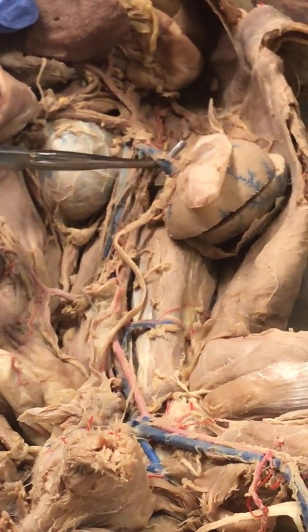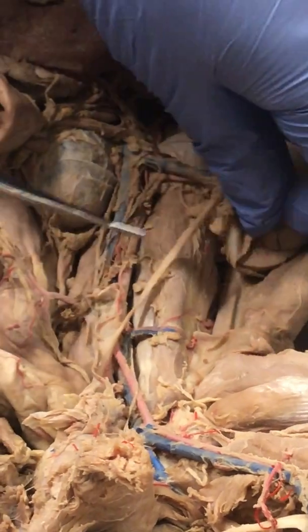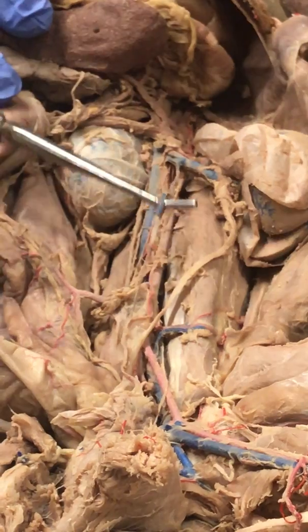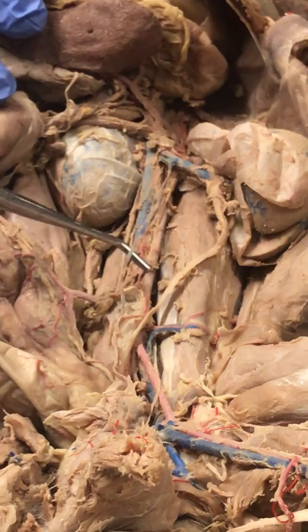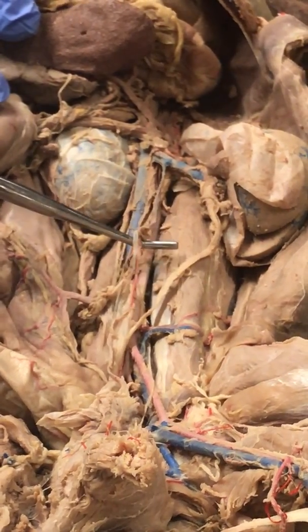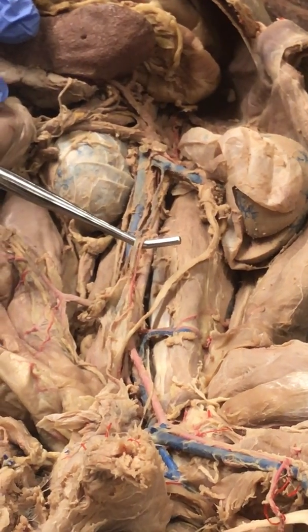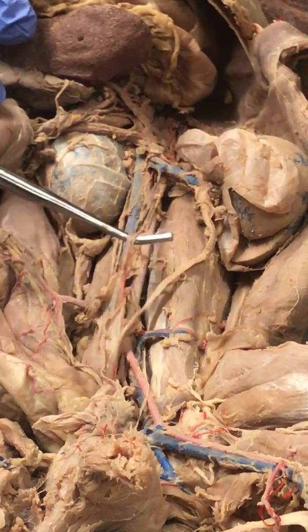Alright, now if I follow this portion here, you see that vessel? That's the renal vein. So this is the renal vein, and you also see the renal artery. Now, interesting, coming off of the renal vein, you get to see this little vein. This is the left testicular vein. It's going to go down to the testicle. And look. If we say gonadal, would it be wrong? Yeah, I want you to say either testicle or ovary because you should be able to tell the difference by now. Okay. Now, you can actually see these two vessels. This is the left testicular artery and the left testicular vein, right?